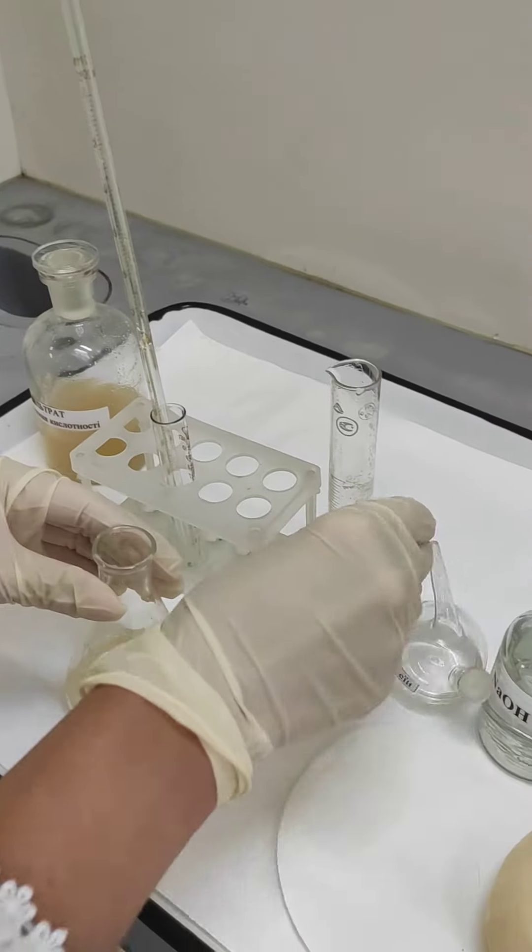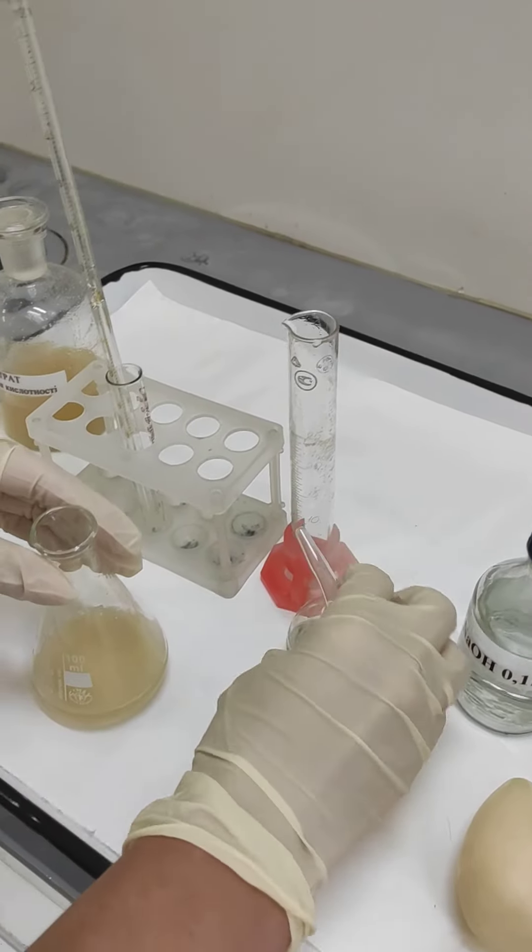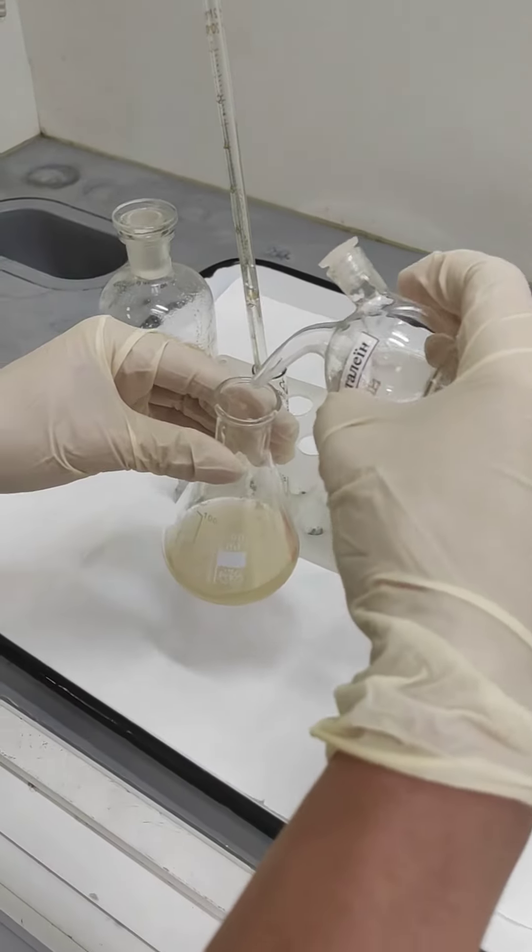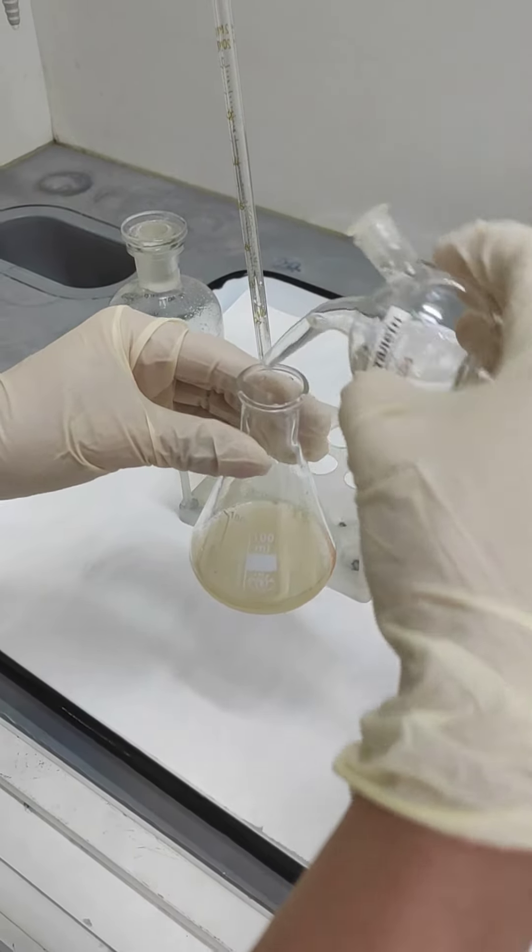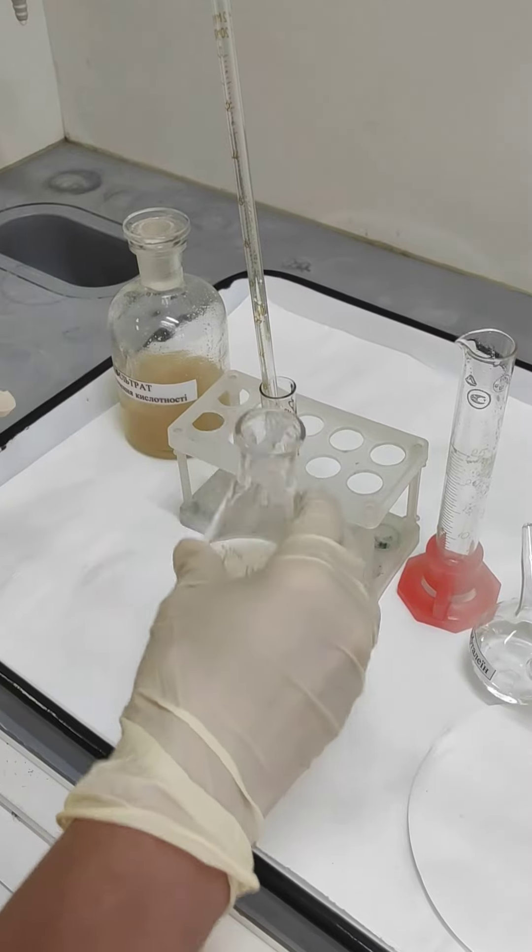Next, we take the solution of phenolphthalein and add three drops, mixing by shaking.